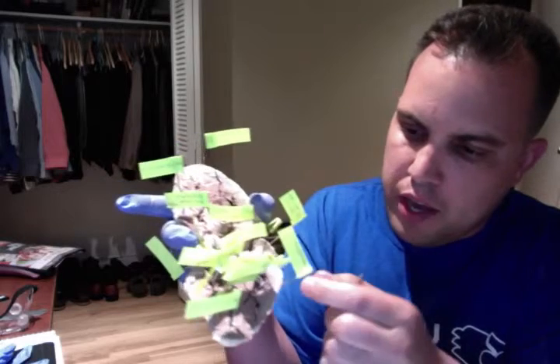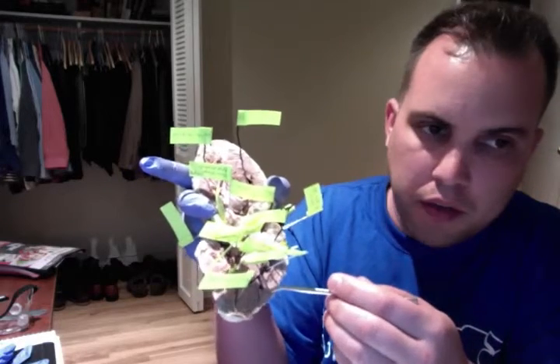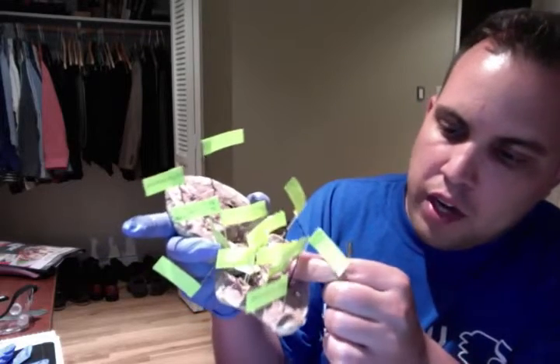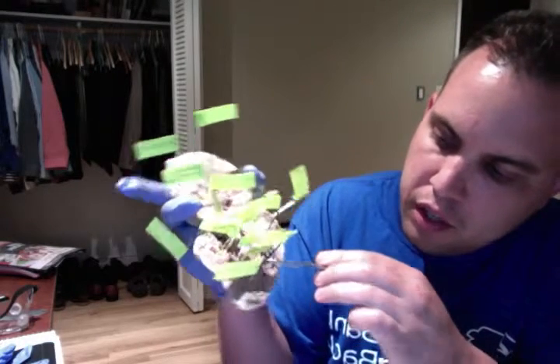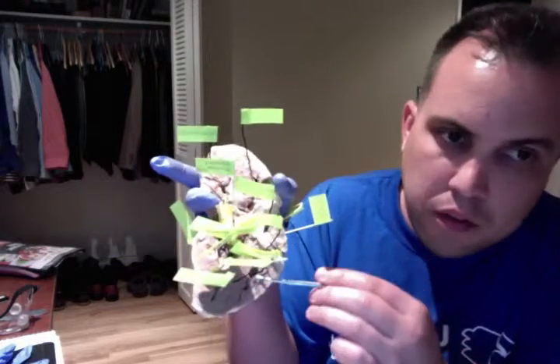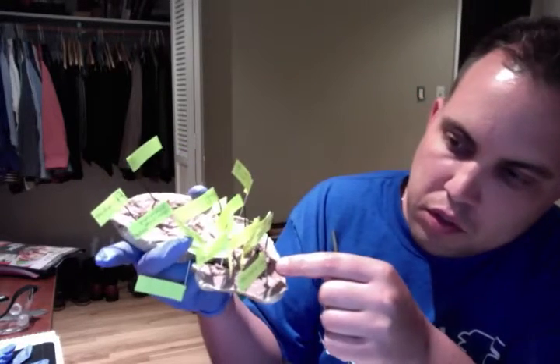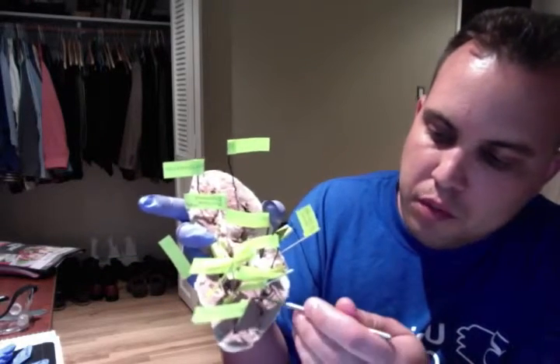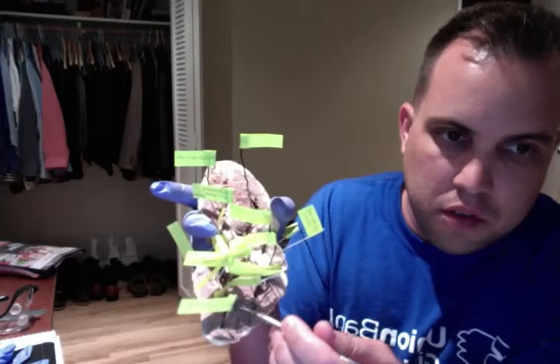I did mention earlier that we have the epicardium right here. Moving forward, we have the chordae tendineae, right in here, just inferior to the right atrium. Then we'll go over to the interventricular septum right here, which is separating both the right and left ventricles. So this big piece here.